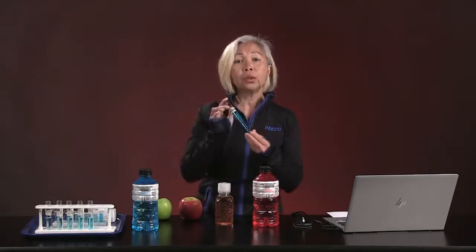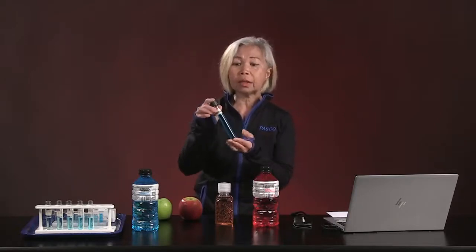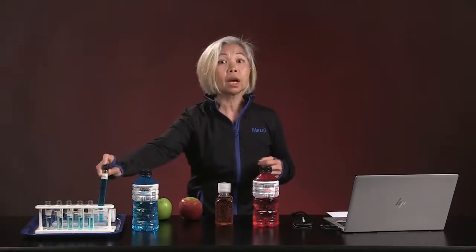and that's exactly what we're going to be doing today. In fact, in today's lab, we are going to be using a model ionic solution of copper 2 sulfate. It is this beautiful aquamarine color. And our lab today is going to come in 3 parts. First part is we're going to actually see how a colorimeter sees the color of copper 2 sulfate.